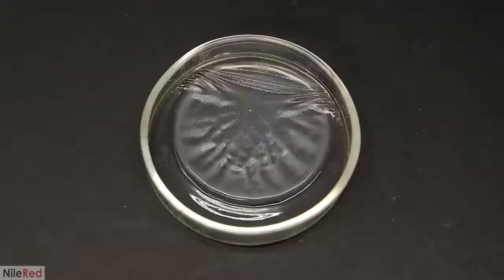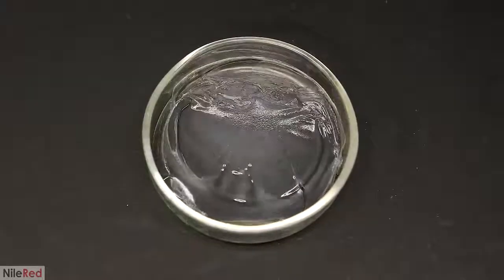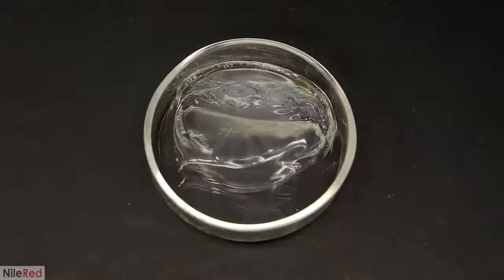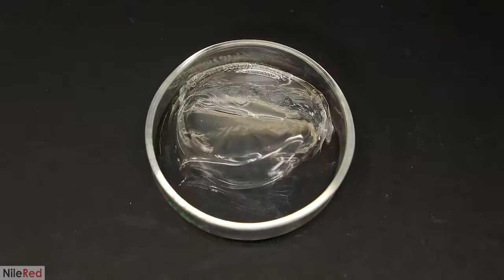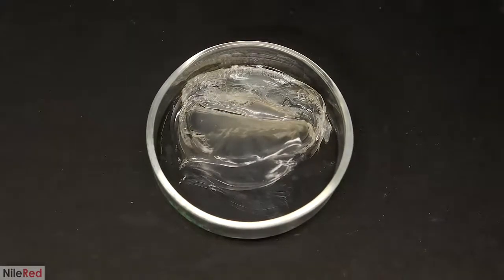I also want to see what would happen if I lightly blew on it with a fan, and the answer is that it's not good. The solvent evaporated off way too quickly, and the triacetate contracted in on itself. By the time all the solvent disappeared, what I was left with was really sad looking.